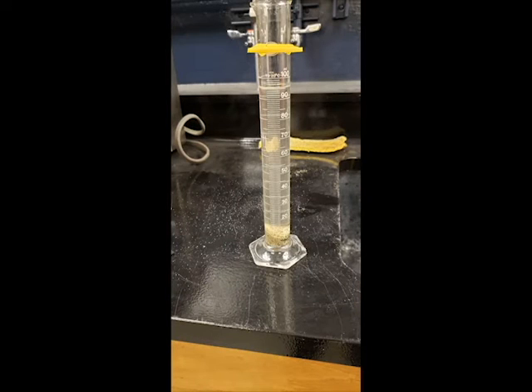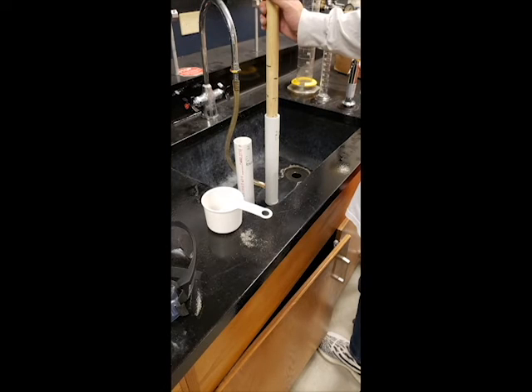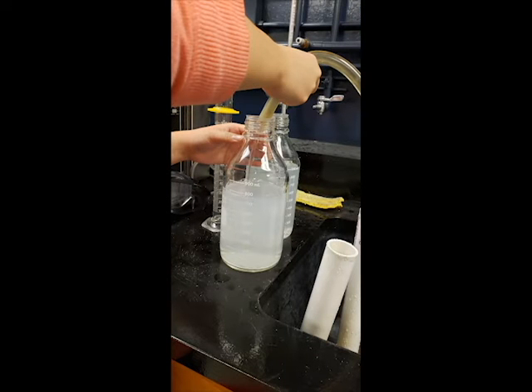To determine the void fraction of the packed bed, the density, volume of the mixture, and volume of the voids were measured. The void fraction came out to be 0.38. When filling the columns with the mixture, to ensure that we got the correct bed height, we marked a dowel so that when it was placed inside the column on top of the sand and carbon mixture, it would read the correct height. The pharmaceutical we decided to filter was acetaminophen.